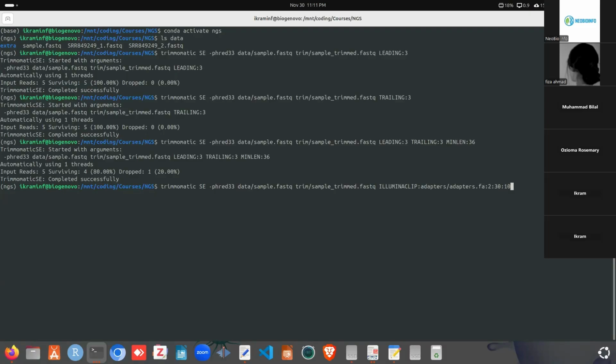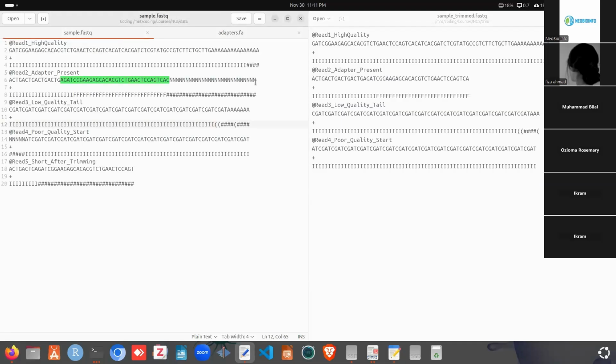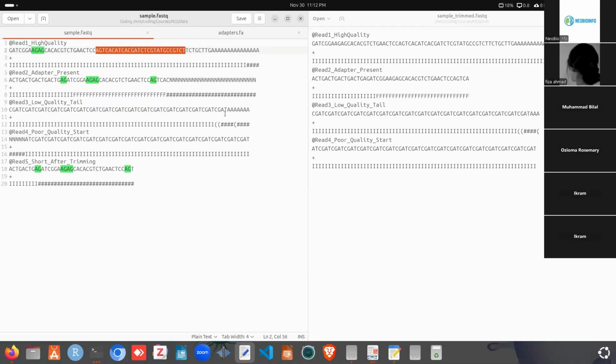So what does this mean actually? Here we have the adapter sequence and we search all the adapter bases in this sequence. So when we specify seed length 2 in here, what Trimmomatic actually does is it takes the first two bases of the adapters just like this, and it searches for the two bases in each read. So here we can see some matches in here, and if it finds some match, then it aligns all the other bases. That is, when it finds AG in here, then it will take all the other bases in. We can see in here, it will match the entire adapter sequence with this actually. So this is how the seed actually works.